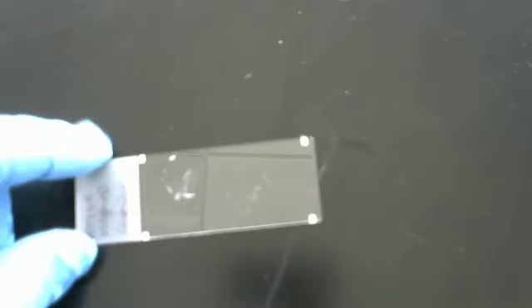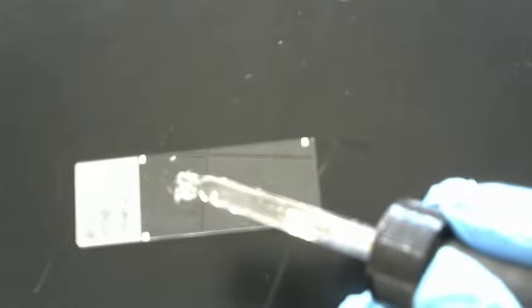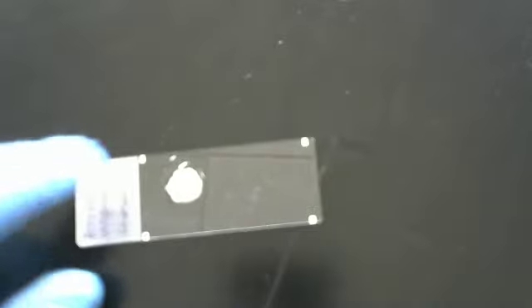So, let's pull out. This is now our Proteus vulgaris. Ah, there we go. It's hard to see on your end because you're zoomed in, but that white area that you see are bubbles. This is a positive test.